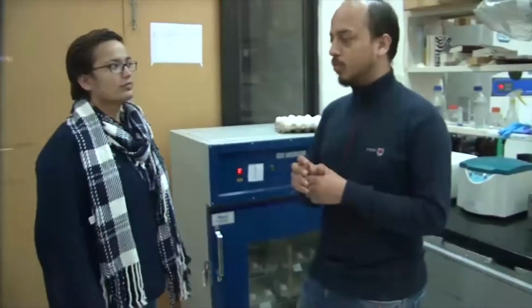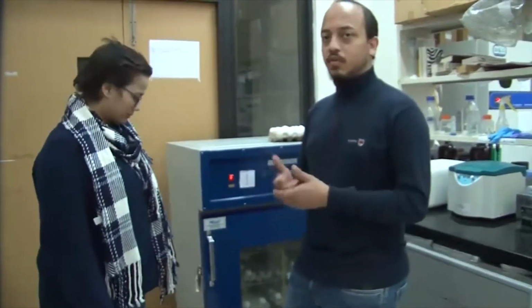In our lab, we have two groups, one working on brain and the other on bone. We use viral DNA and electroporate it into the chicken tissue. Because it's viral DNA, it integrates itself into the chicken genome, and then we get the necessary phenotype of each gene that we have studied or want to study.